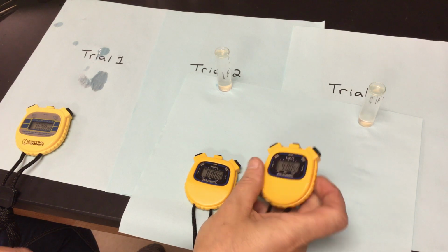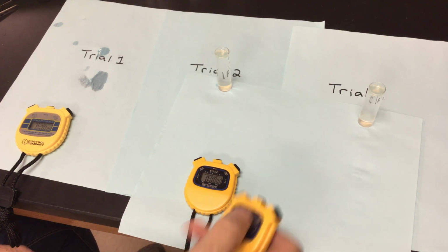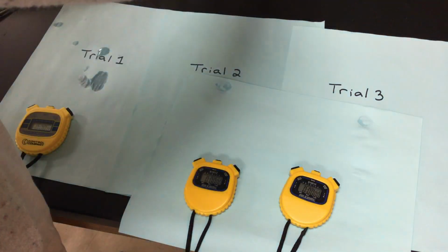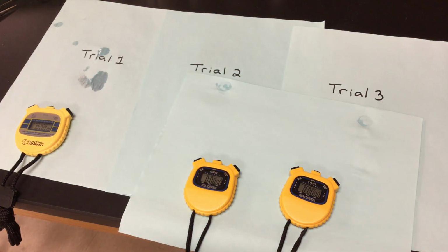And we are at 4 minutes for the last one. So my discs are still at the bottom. My catalase was not able to work. What about that particular pH that did not allow it to work? Okay, so we're going to stop the video on this part here. We're going to come back in a few moments and we'll talk about our temperature portion of it.